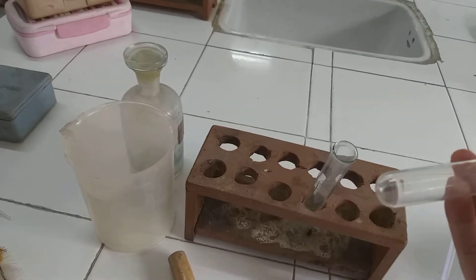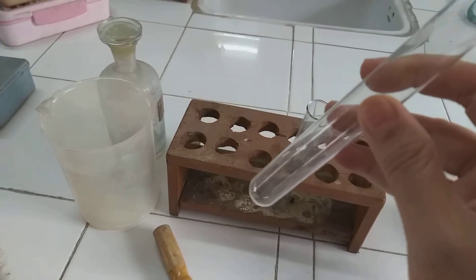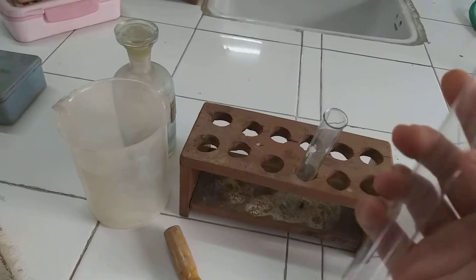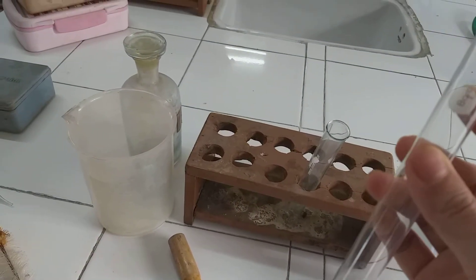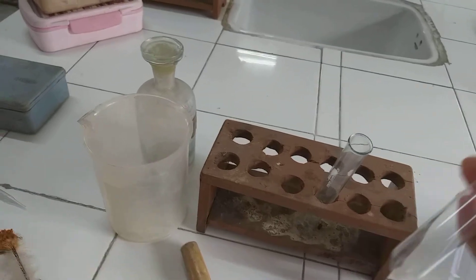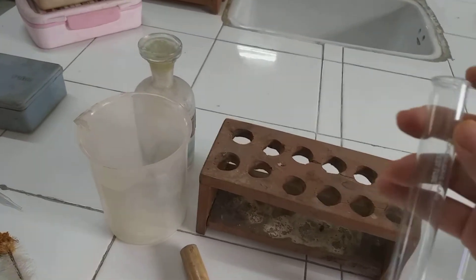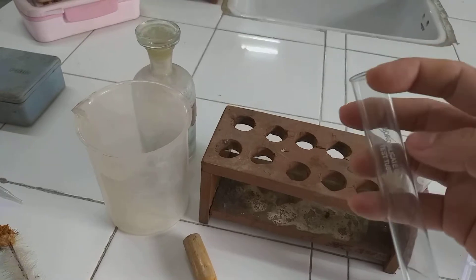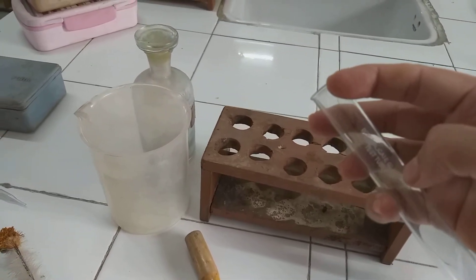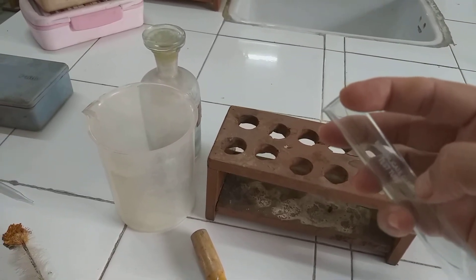There are various capacities. They are made up of a very good quality glass which does not break easily. This one is of about 20 ml capacity. The name of the glass is borosilicate glass, which is used for making these test tubes, as written on the label.